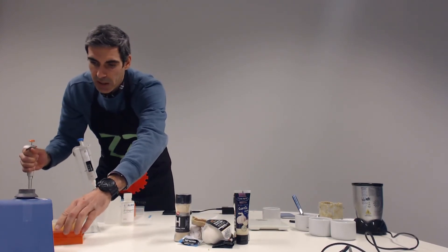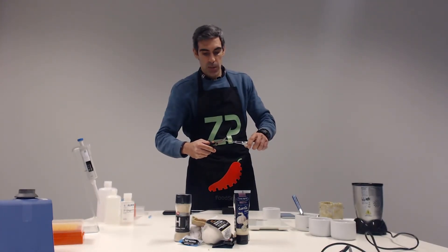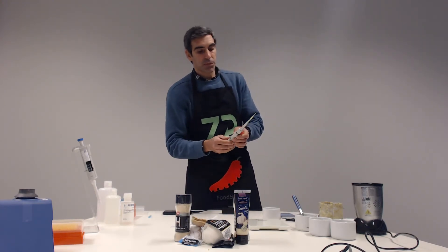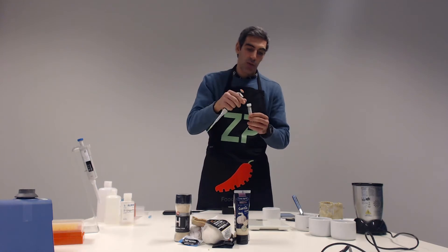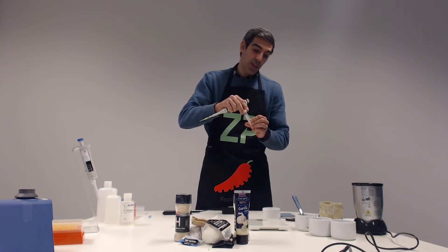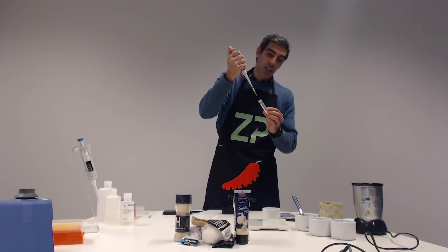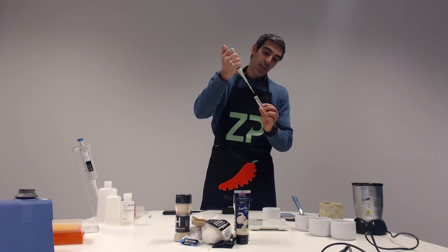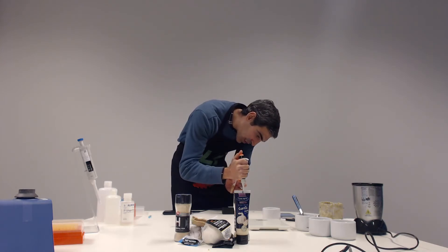So here, one pipette tip. A small trick: because there will be some food bits, very small ones, I advise you to cut off the pipette tip a little bit in order to be able to grab some small chunks in the fluid and not jam the actual pipette tip. Okay, so I waited approximately three minutes. So here I'm going to take the slurry.